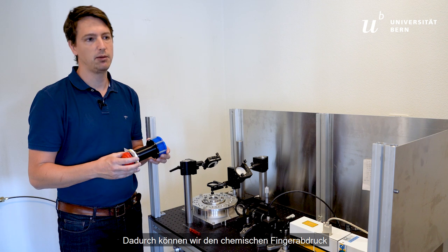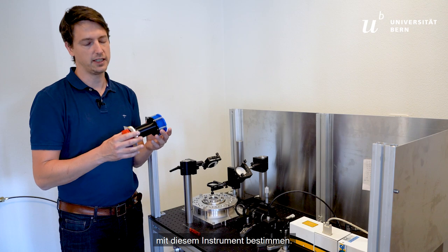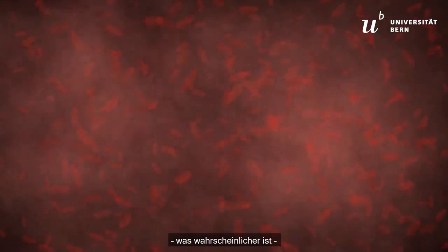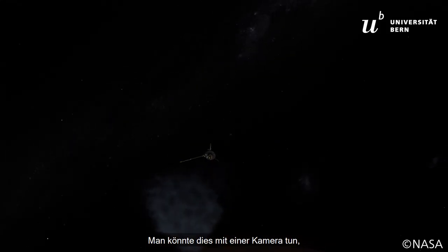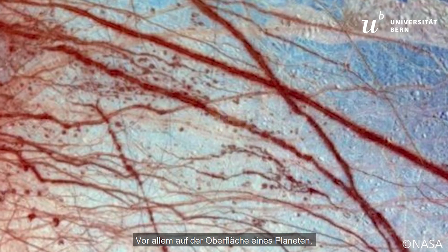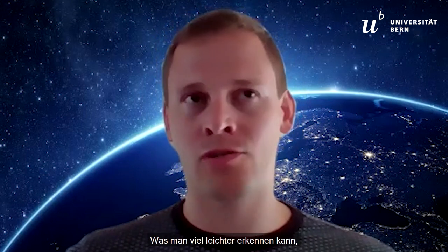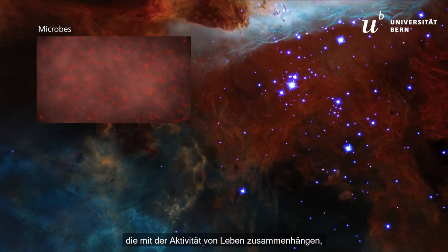When the material is ionized, we can record the chemical fingerprint of that ablated, dissolved material from the surface with the instrument. So when we are looking for life, we might be looking for actual organisms, which may be animals or more likely smaller things like microbes and bacteria. You can do that with a camera, but they might not always be present where you expect them to be, especially on the surface of a planet, which is heavily irradiated and they don't like to live there.